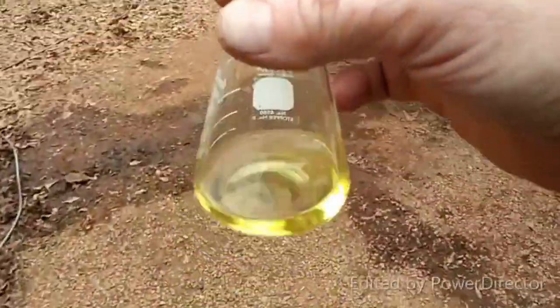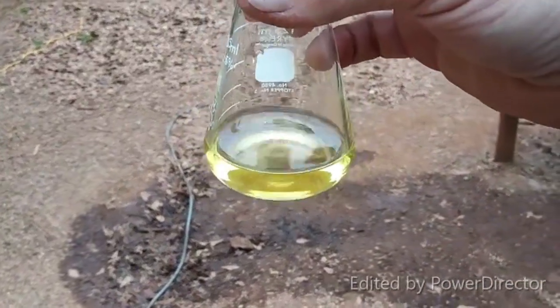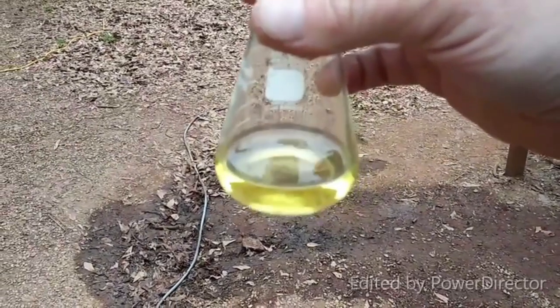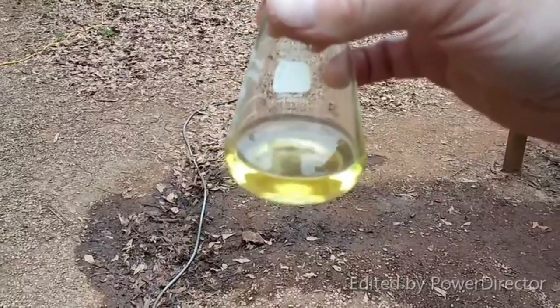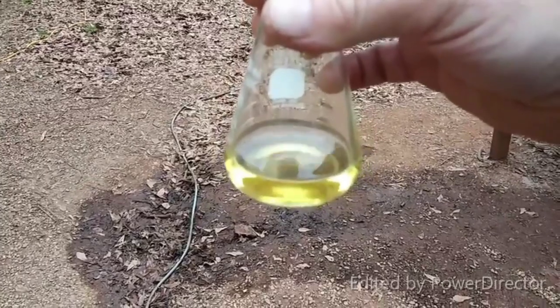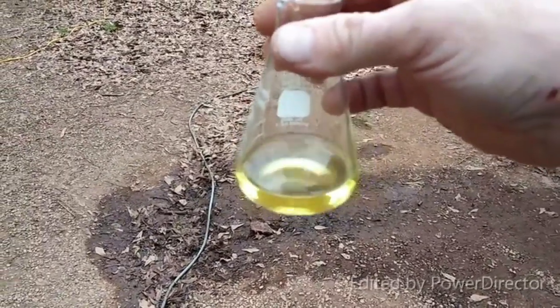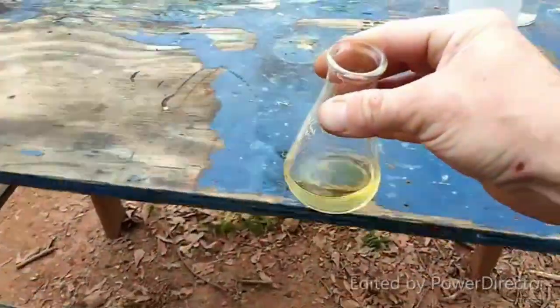This is a solution of potassium tetracyanonickelate 2. And all I'm going to do now is evaporate this down until I start getting crystals off of it. Then I'm going to put it in ice water, and once it fully crystallizes, I'll filter those off, air dry them, and then I will have the final product. So I guess I'm going to keep going on with this project, and I will carry it through to the end.